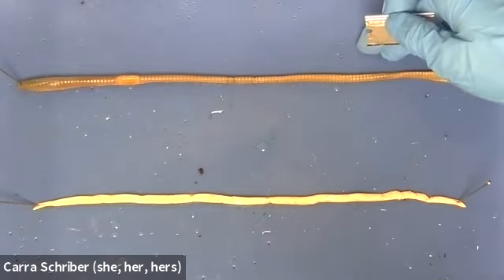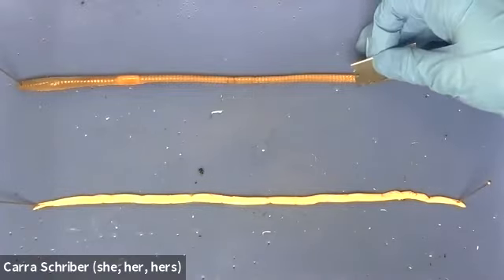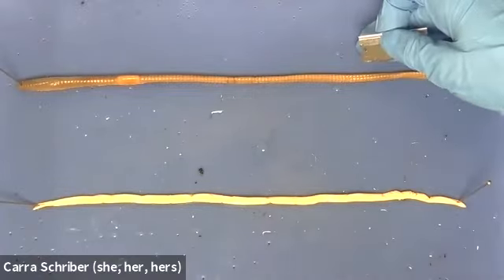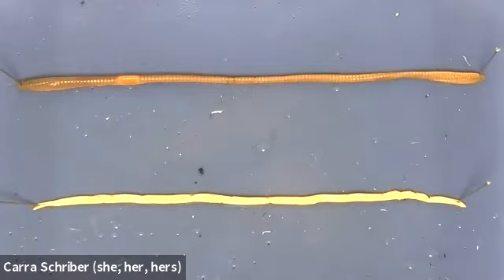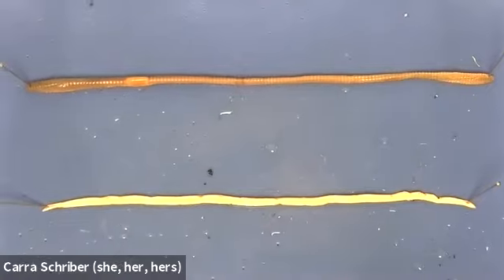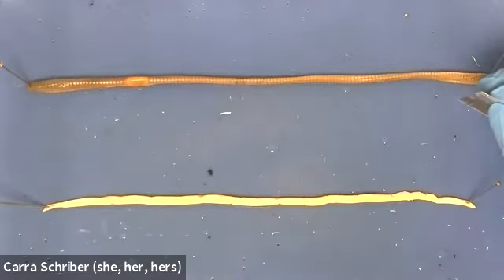One of the main things with an earthworm is that it has a lot of connective tissue that connects the ectoderm, or the skin, to the internal components or the organs. So we'll take a look at that here. We'll just do part of this dissection. I want to show you how different it is to dissect them. Then I'll take a pause, I'll dissect the rest of it, and then we'll look at the internal components.